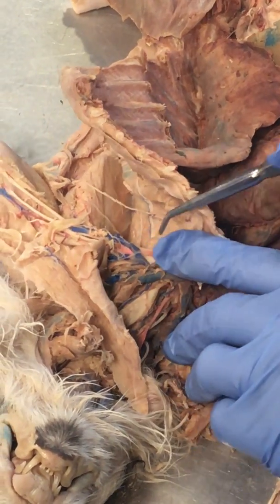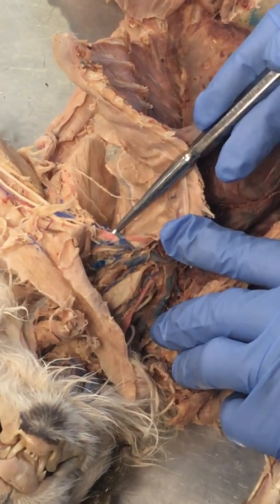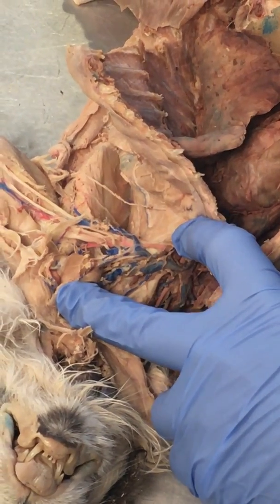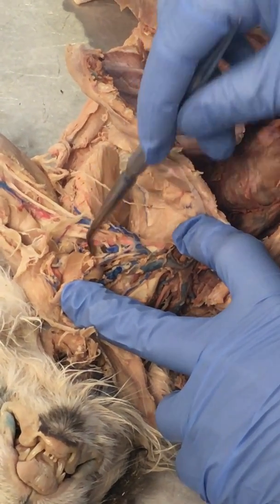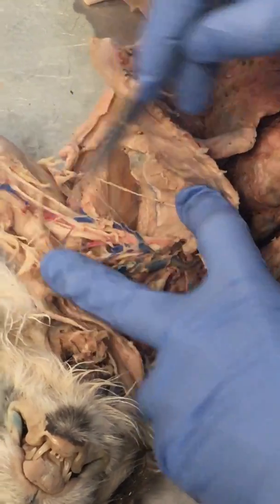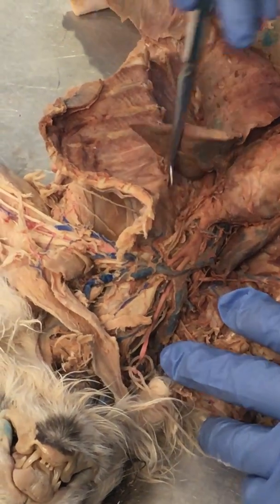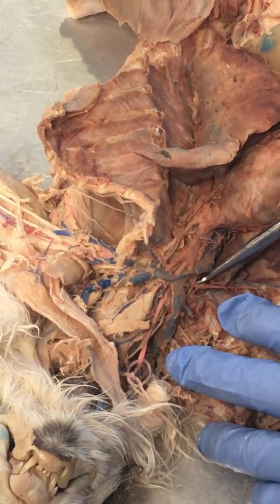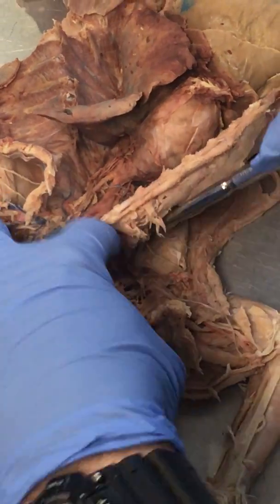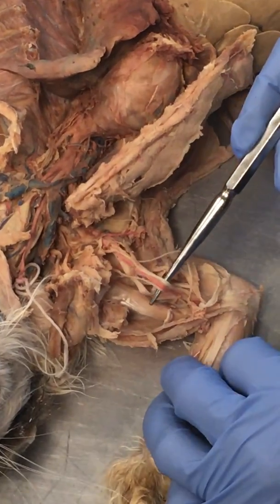Once we get past the first rib, we're now in the armpit region. We'll call this the axillary, because armpit, axillary, the same thing. And then once we get past the inferior border of the teres major, the axillary actually becomes the brachial. But I'm not going to ask that on the test. So what I would say simply is if we tagged it right here, you would say subclavian. If we tag the one on the right-hand side, we would call this subclavian. Once we get past the ribs into the armpit region, we're going to call it axillary, and when we get down into the arm, then we'll call it brachial.